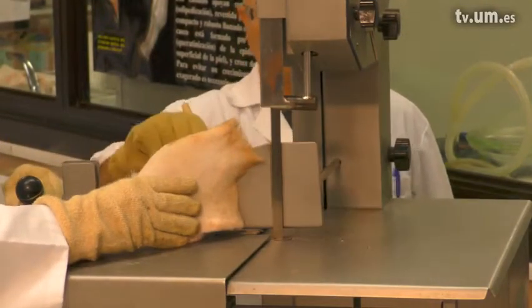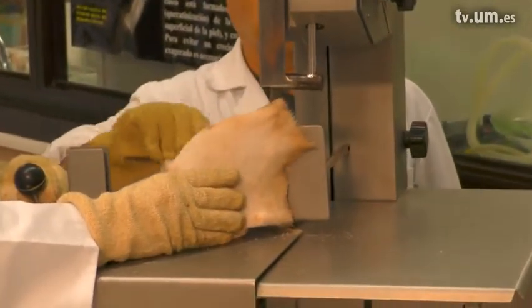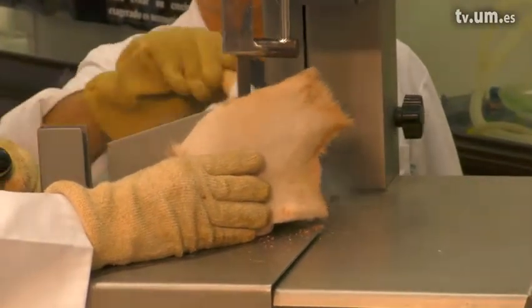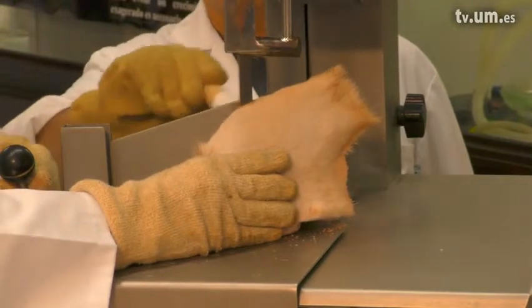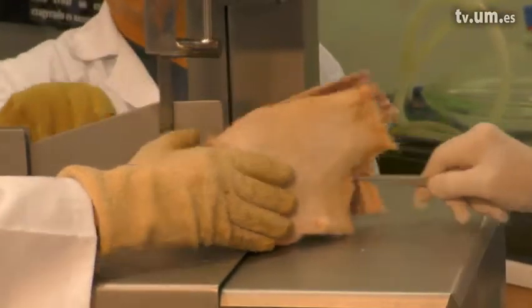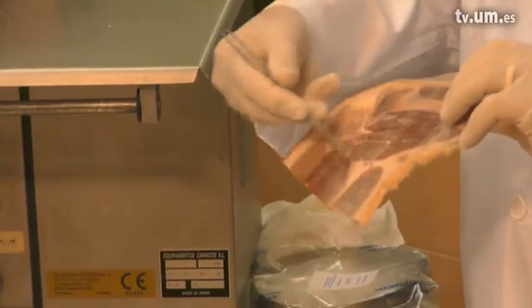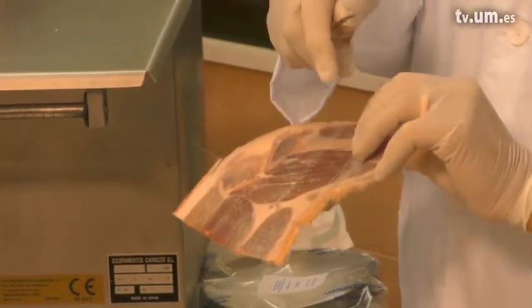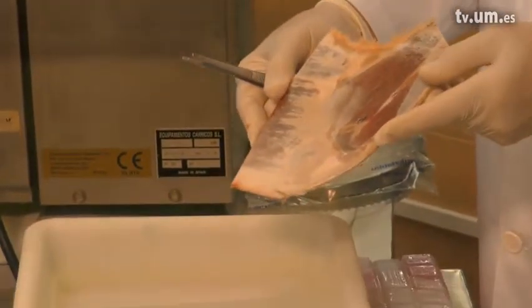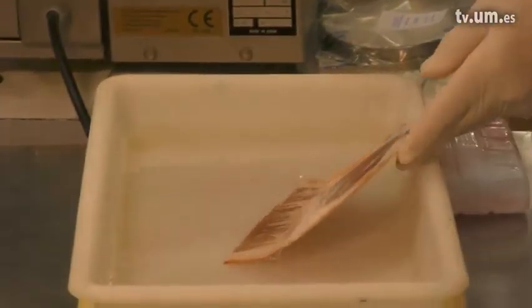He's slicing a three-millimeter specimen down the long axis of a bone. Once the sawing is completed, we'll put the specimen in cold acetone to clean it. Here is the specimen — you can see the saw marks. We'll take it out and clean those saw marks and the sawdust off. More sawdust on this side, which will be cleaned off to get it ready for dehydration.